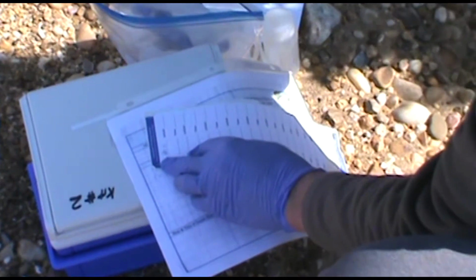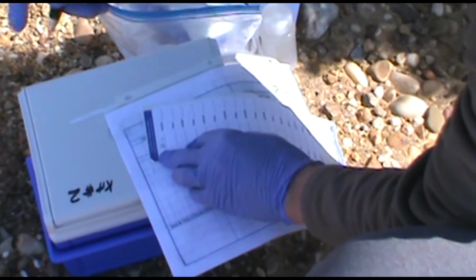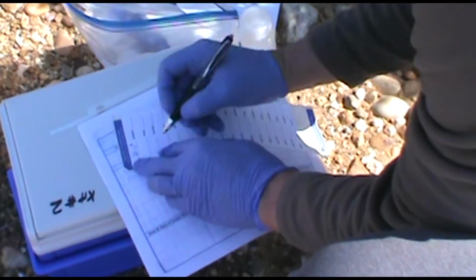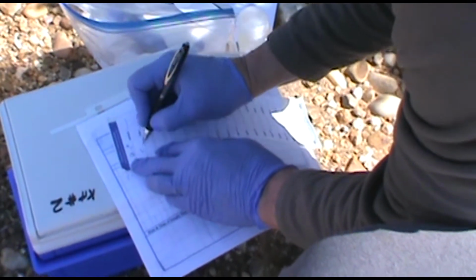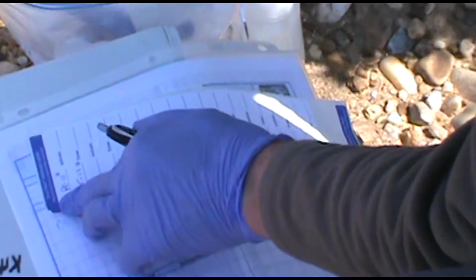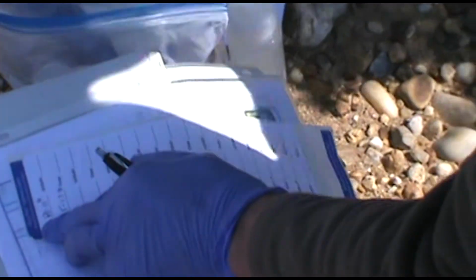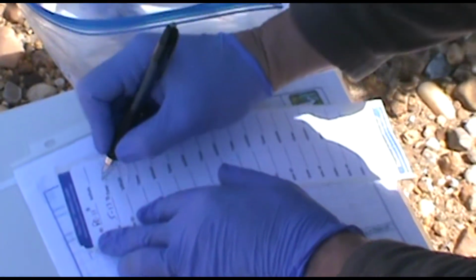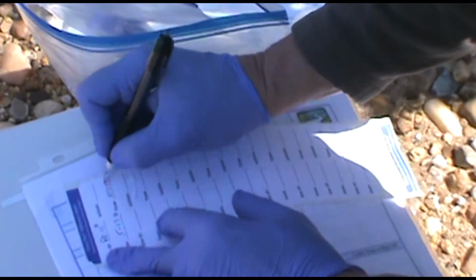A is going to be the dock, and B will be the point here. And we'll just have to document that in the plot. So we did that. Bacteria about 1035.